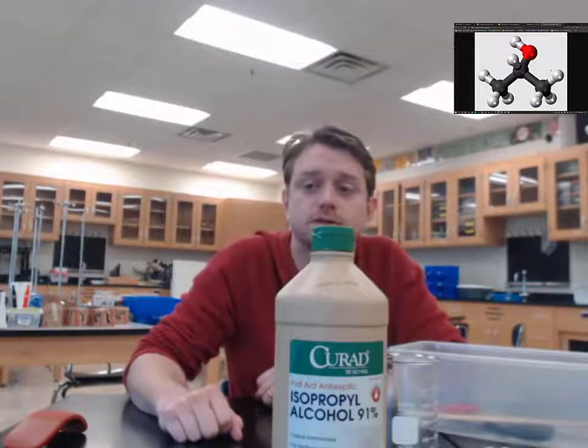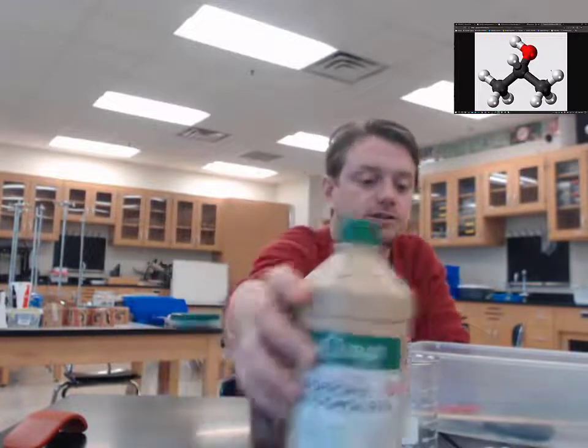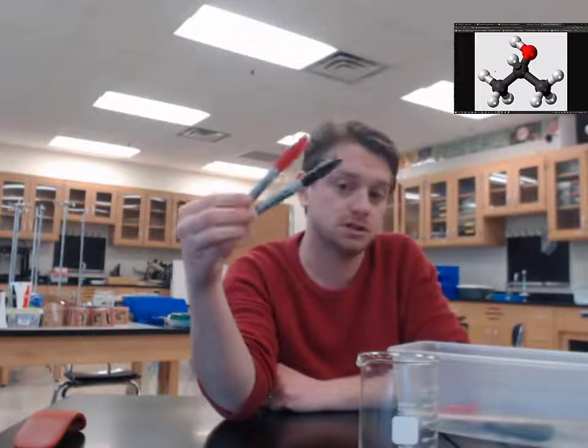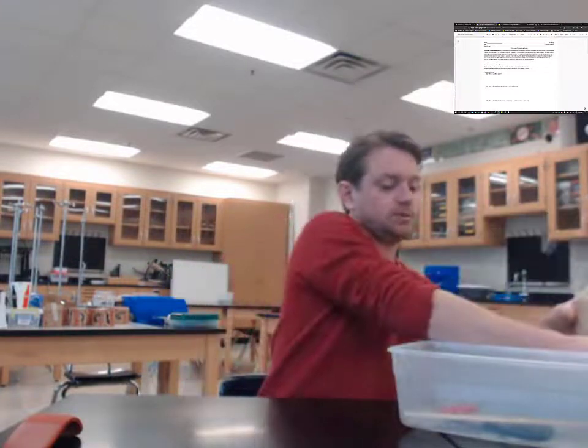Having our strips hanging down into the beaker, the isopropyl alcohol at the bottom is going to rise up through a process called capillary action through our coffee filter paper, and it's going to drag the parts of our mixtures with it. And we should see something interesting. We might see different colors, we might see different types or widths of streaks of ink as it separates. The process of thin layer chromatography will let us see a little bit of what the component parts of our mixture are.